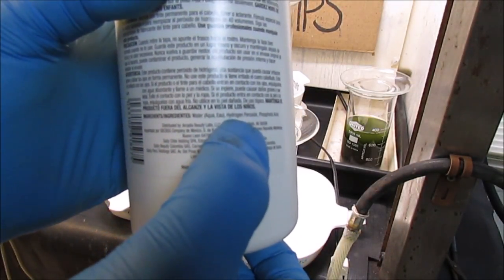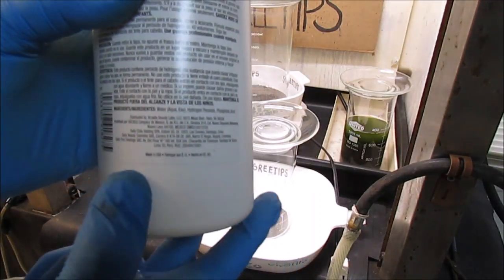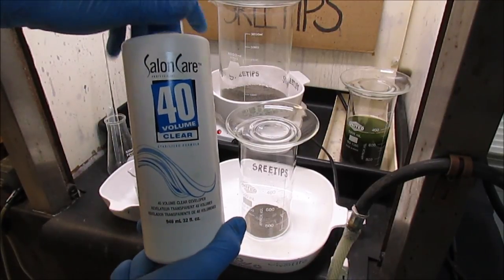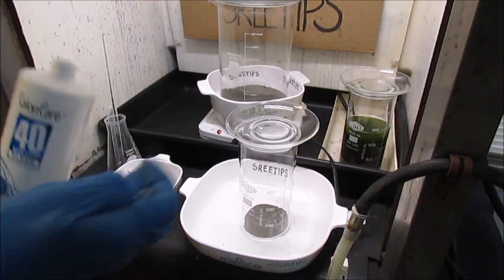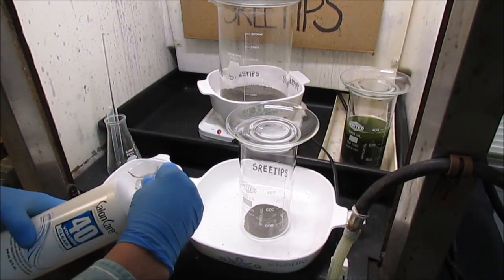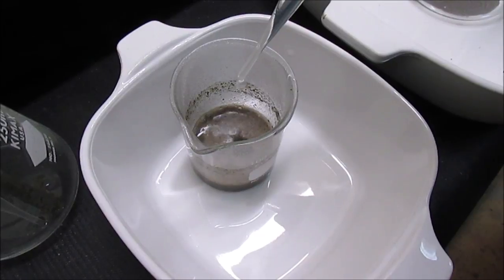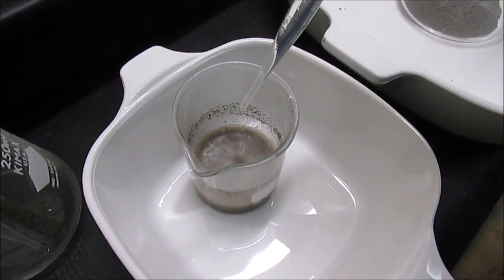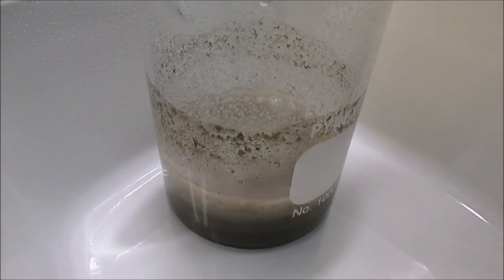Here I have some hydrogen peroxide that I bought from Sally's Beauty Supply. I'm going to add that to the beaker that has the ash and concentrated sulfuric acid and make some piranha solution. Piranha solution dissolves carbon, it converts it into carbon dioxide and water. This was suggested by one of my viewers to try to get rid of that carbon from the ash and also to possibly remove some of the copper from my precious metals.